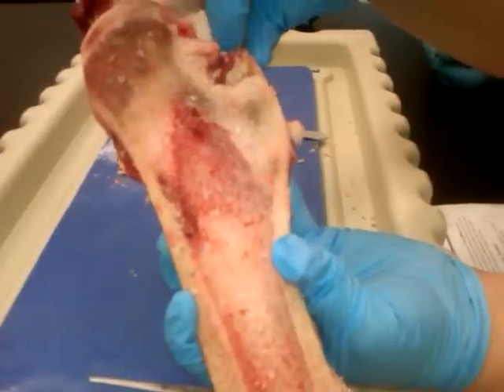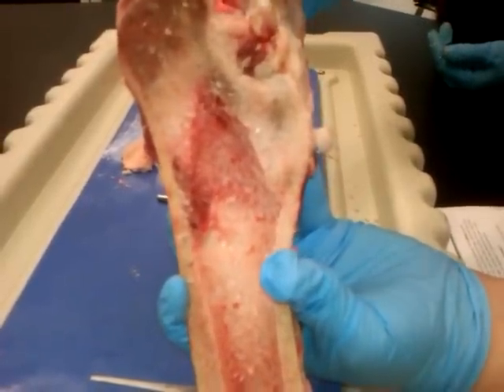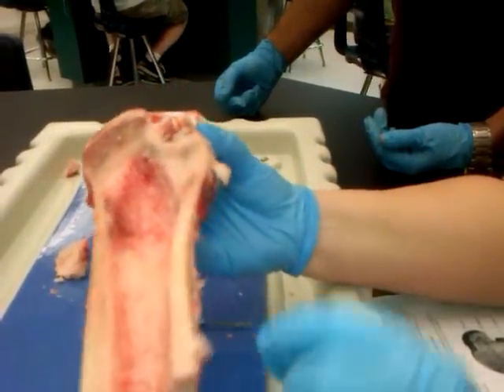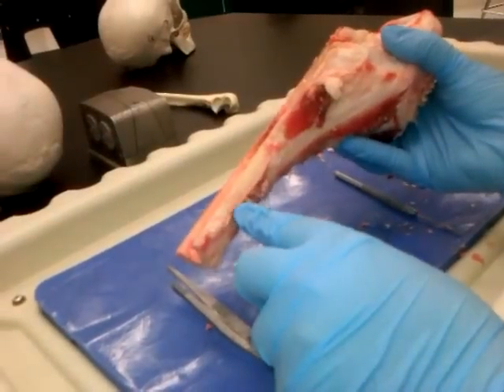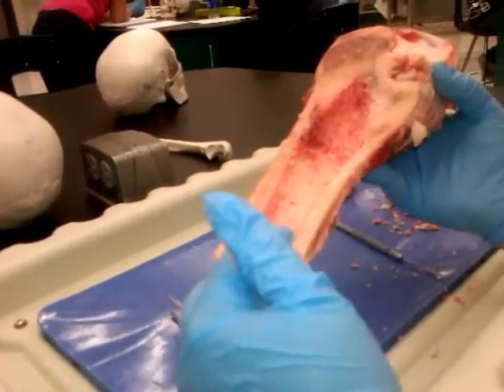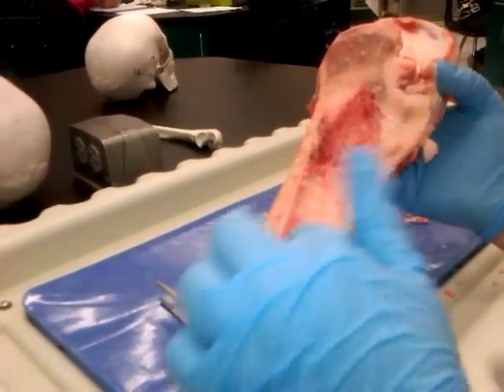And then this — is that a tendon? It's either a tendon or a ligament, one of the two. Compact bone — that's what I was trying to think. So this one is the compact bone.